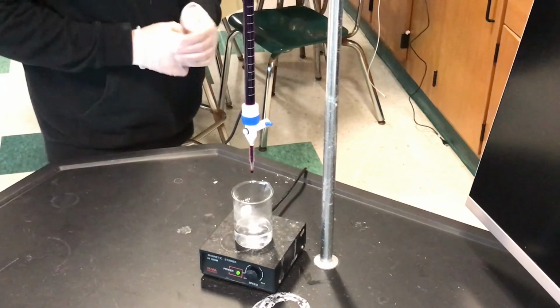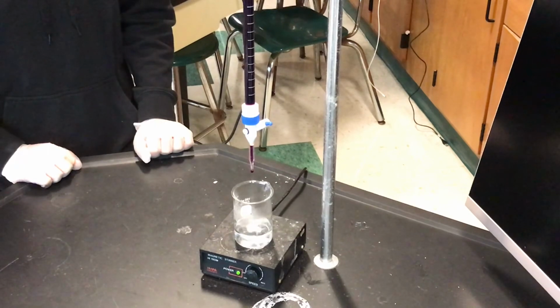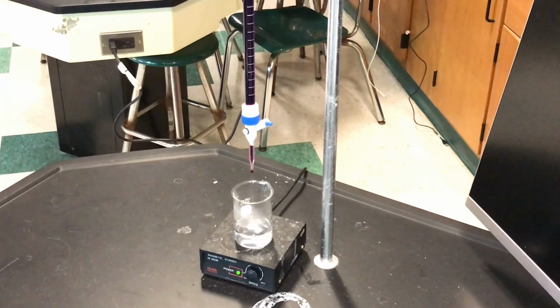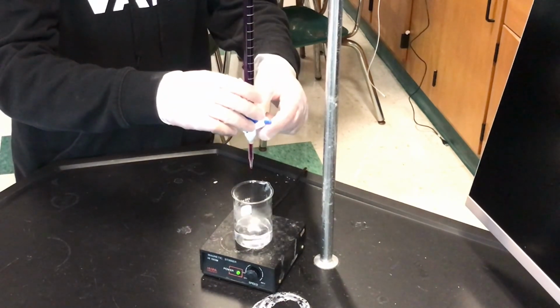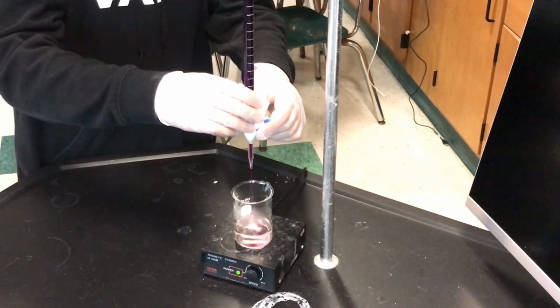So we're going to go from student L to student E. And now, before you titrate, you better write down your starting value. 22.50. Okay, because you're going to have to subtract from that. So that's the initial volume? That's your initial volume. Okay, same thing. Start adding carefully your potassium permanganate, which is going to go clear because the +7 goes to the +2. And when it persists, you know that you're getting close.